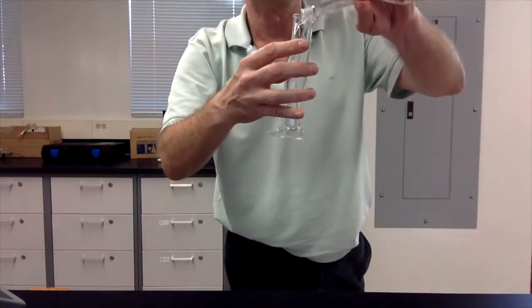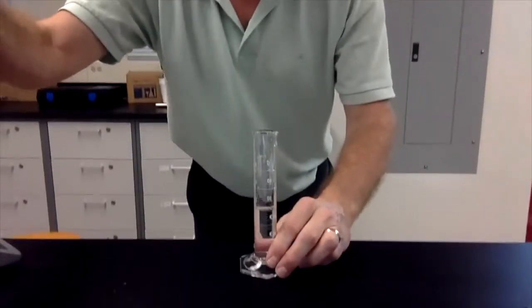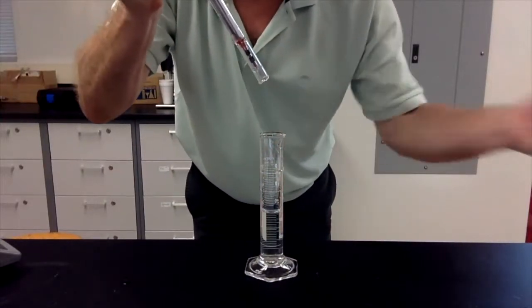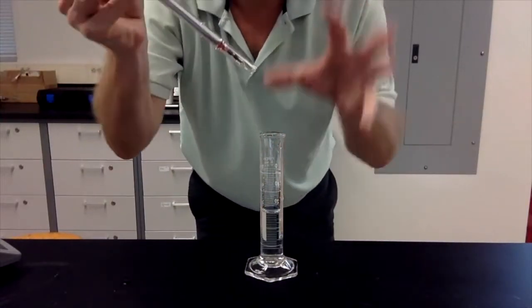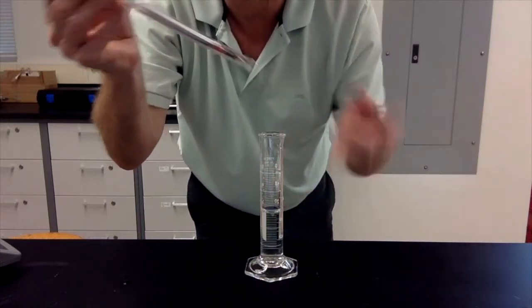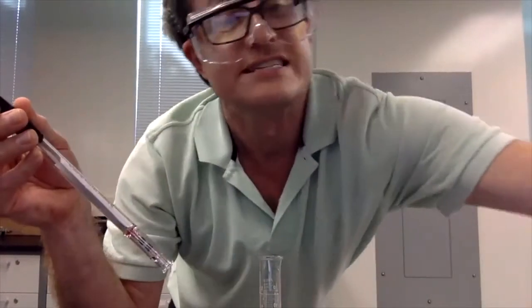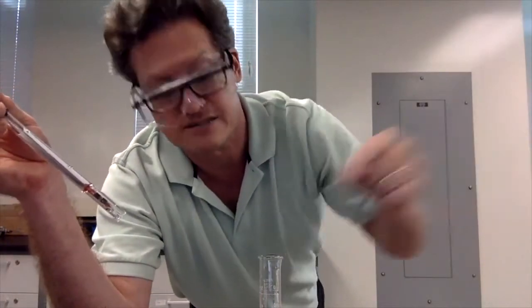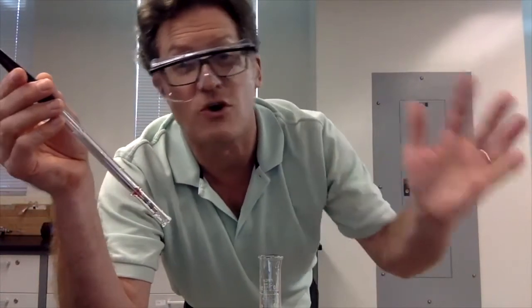Then we fill it up with our solution, enough to completely submerge it, right? And if we were to transfer, unfortunately, a drop of the old solution to the new solution, right? If we're going from low concentration to a higher concentration, then it's not going to show up. But conductivity is sensitive to all ions in solution. And if we instead started off with one of the highest concentration ones, one drop of the highest concentration one may have more conductivity in it than the lowest concentration solution altogether, right? So you start low and you go high.